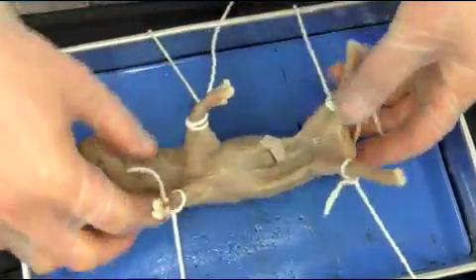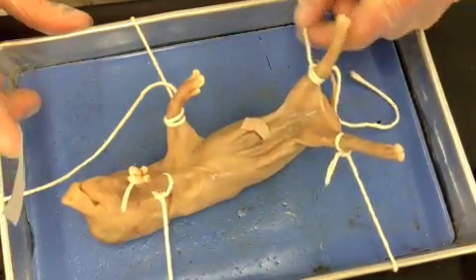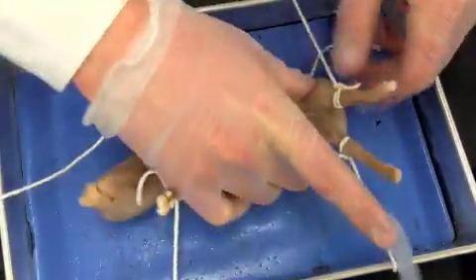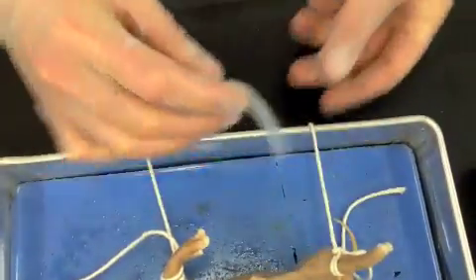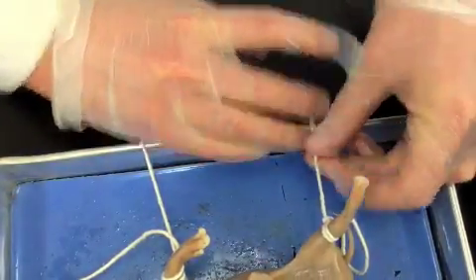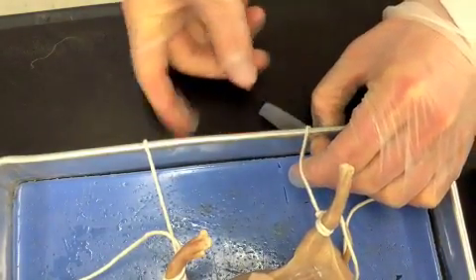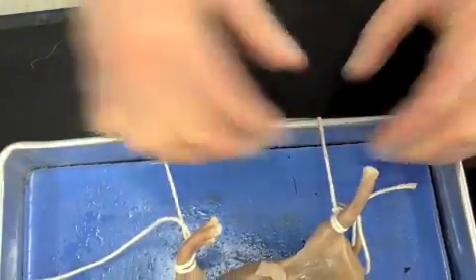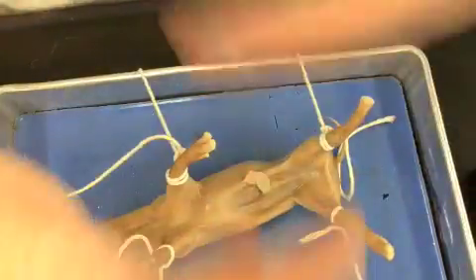Sometimes when you are tying your pig up, it can get really loose and your pig may fall onto its side. A trick you can do is take a piece of tape on the side, pull it down tight, and tape it down. It makes it a little bit tighter so that the legs of your pig are open.